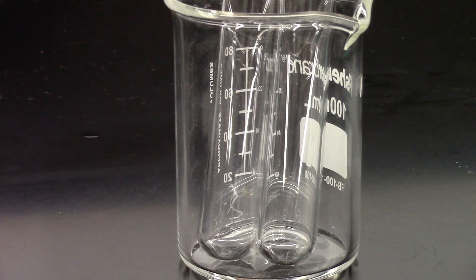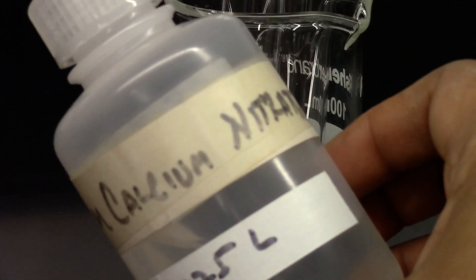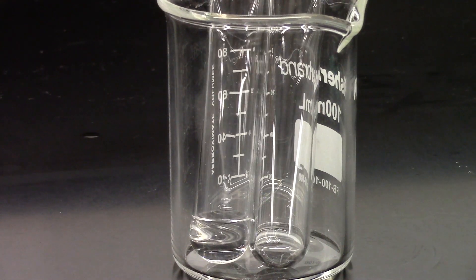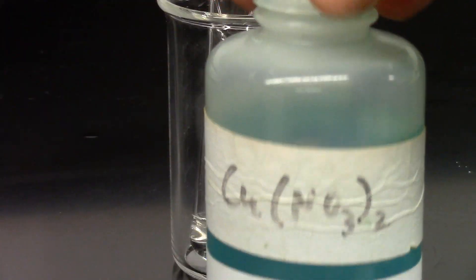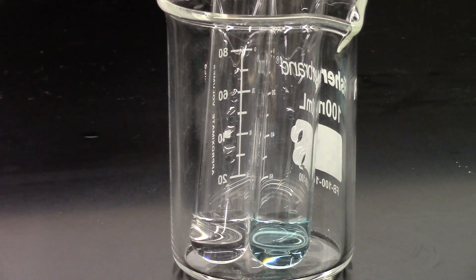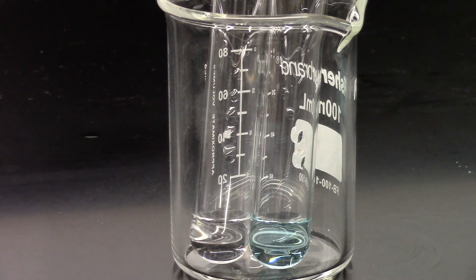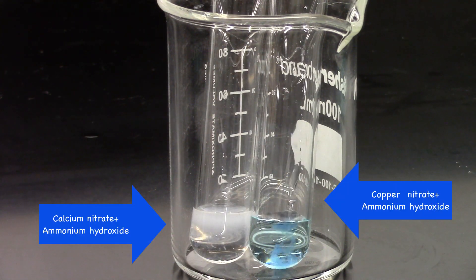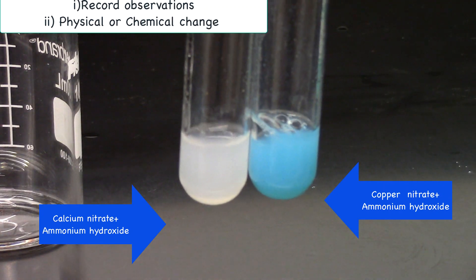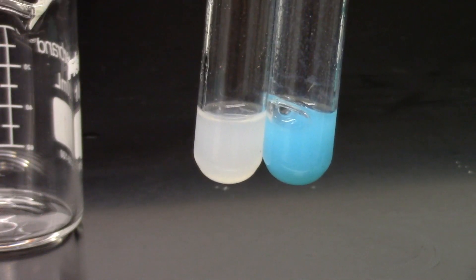I have two test tubes. In the left one I'm going to add 20 drops of calcium nitrate, and in the right one 20 drops of copper nitrate. Now to each test tube I'm going to add a few drops of ammonium hydroxide. The calcium nitrate produces a white colored precipitate and the copper nitrate produces a blue precipitate.